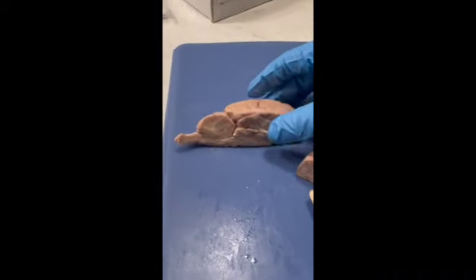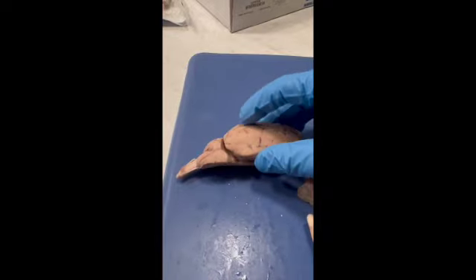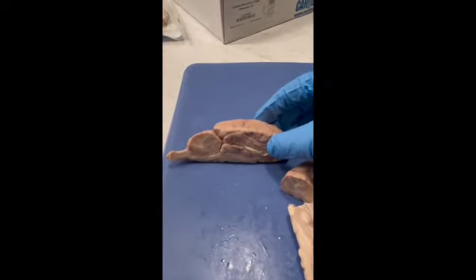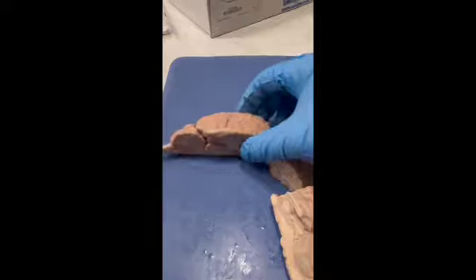Some other things that I noticed are the grooves, the sulci, on the outside. I think that's really interesting. Why is the brain like that? Of all the different textures it could be, it's like this.